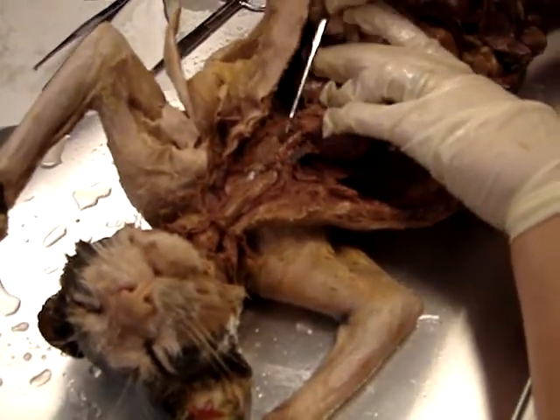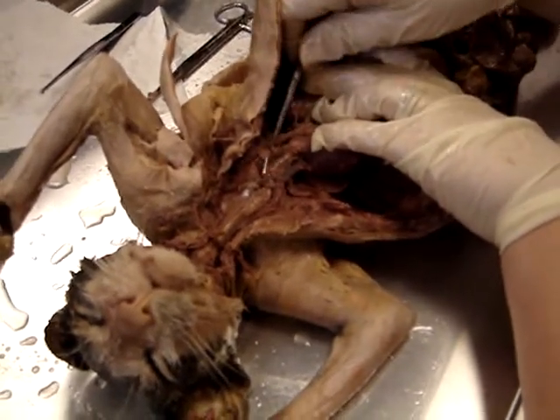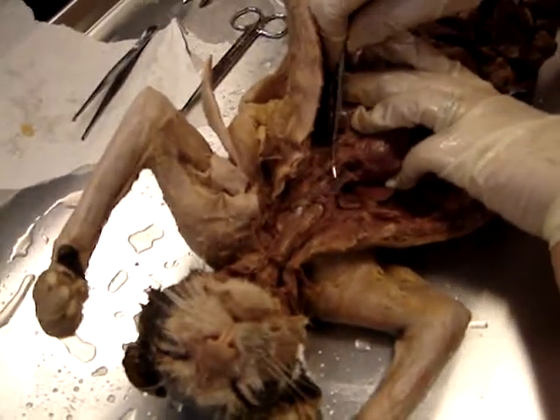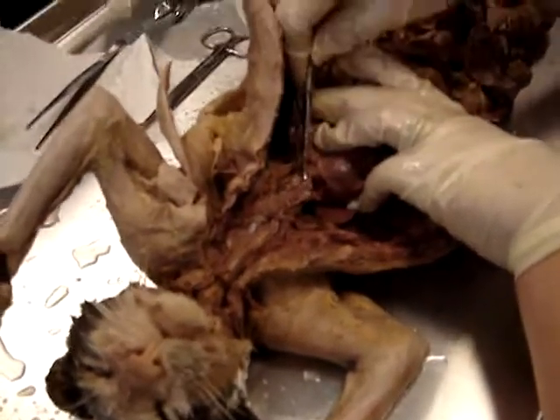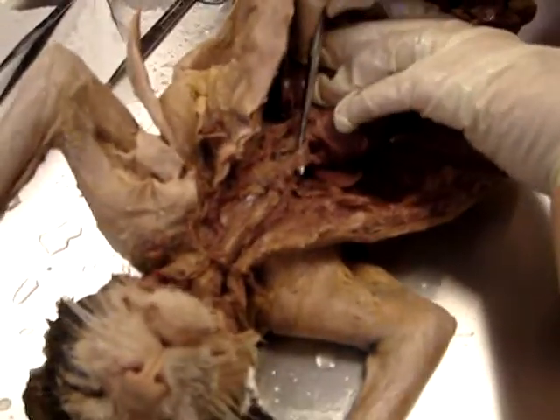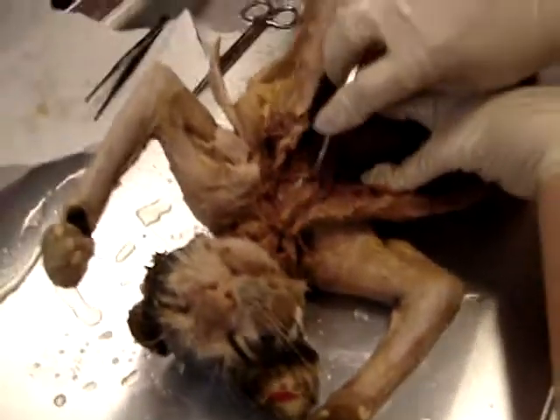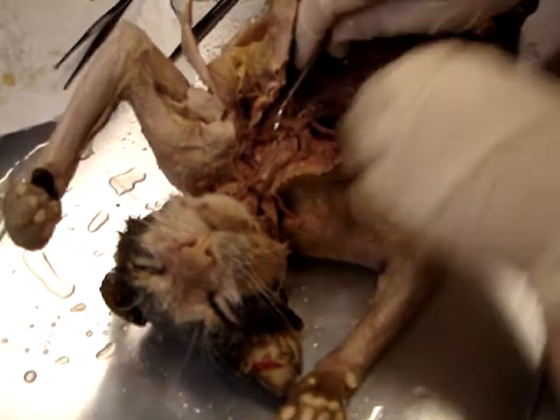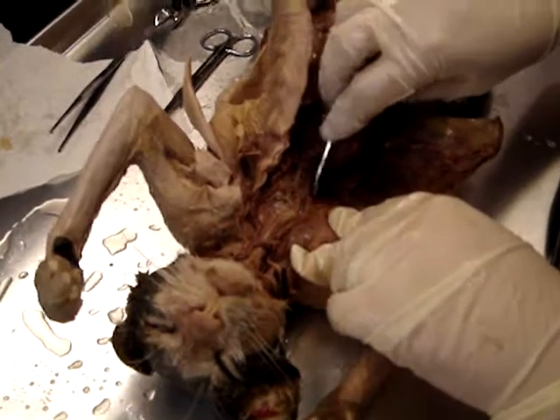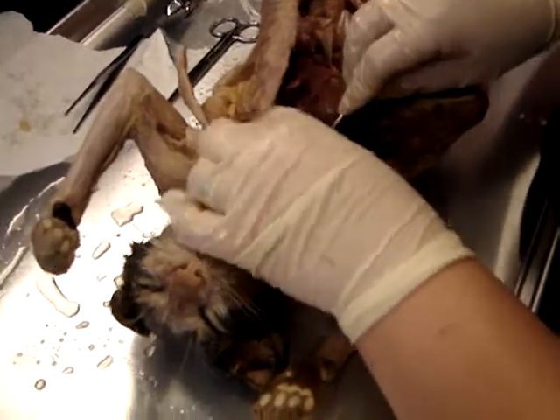All right, the one that's on the left side is the left brachiocephalic, or excuse me, pardon me, erase that from your brains. It's the left subclavian artery, okay? And then this is called the brachiocephalic artery. There is only one brachiocephalic artery. It is not a right and left situation. There's just one, okay? Then the brachiocephalic artery, if we clean along in here, our veins are in the way. We'll get to those in a second. But our brachiocephalic artery should split off into 3 branches.